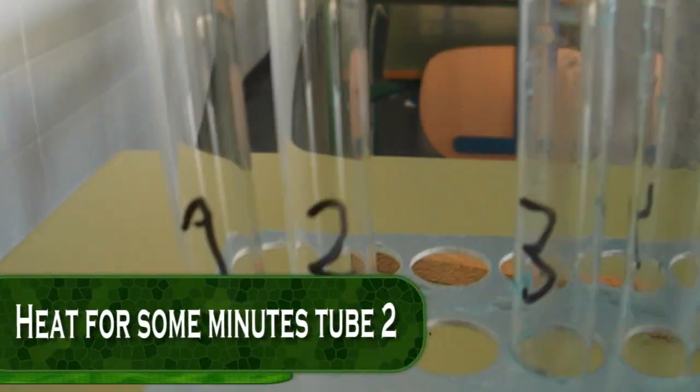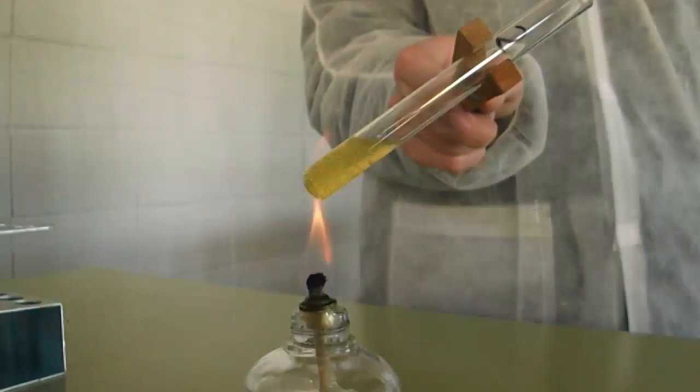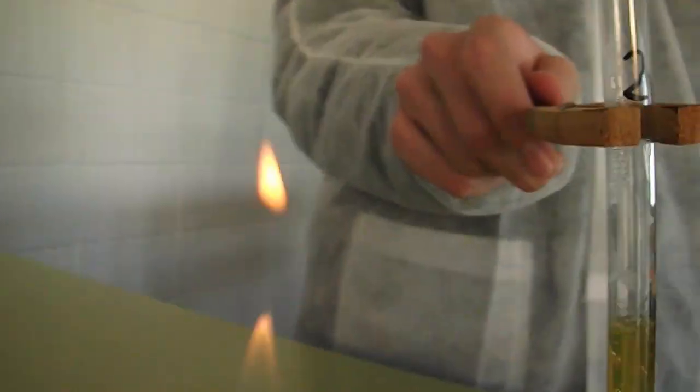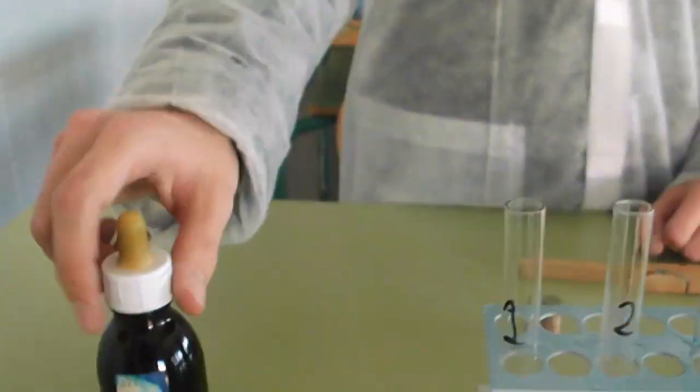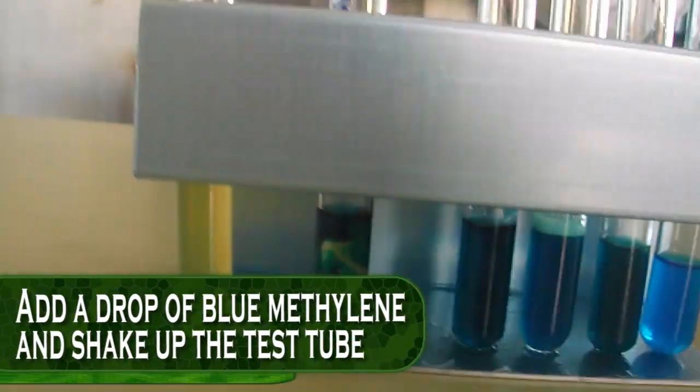Heat tube 2 for some minutes. Then add a drop of blue methylene and shake up the test tube.